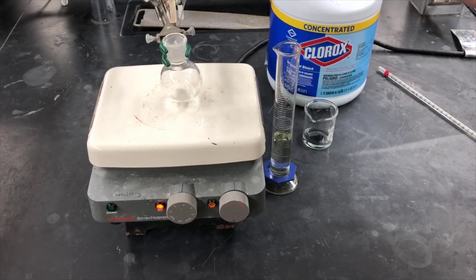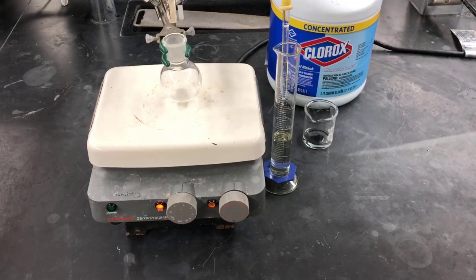Since the reaction is biphasic, it occurs in two layers, you should try to spin the reaction as fast as you can. There is a limit to how fast you can stir solutions.